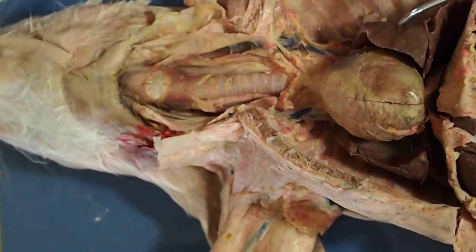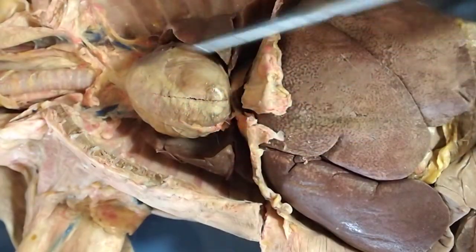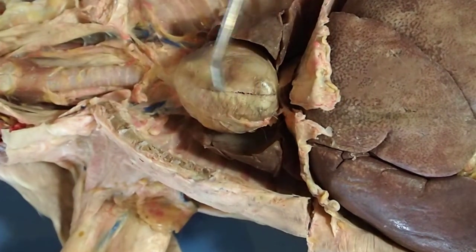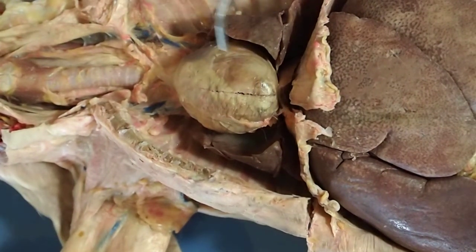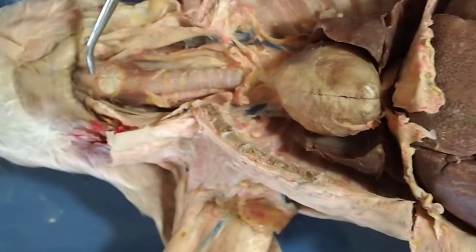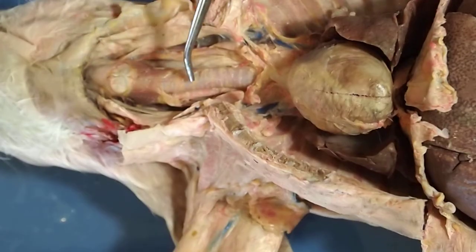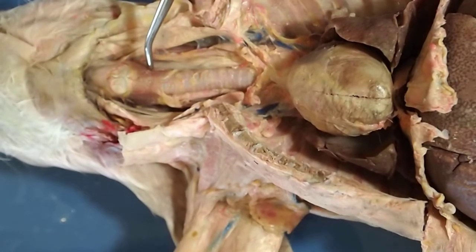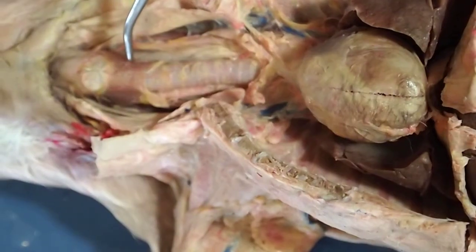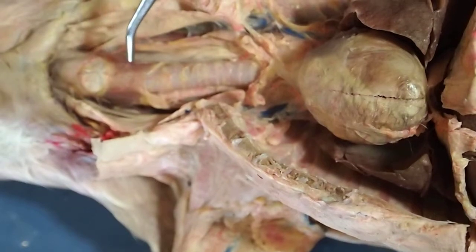Over here we have the left lung, and on the other side of the heart we have the right lung. In the middle is our heart — I should note I accidentally cut it when opening the specimen this morning, so it doesn't normally look like that. Just below the larynx, on either side as we transition from larynx to trachea, you'll see two brown glands — these are the thyroid gland. The thyroid produces hormones involved in regulating your metabolism.